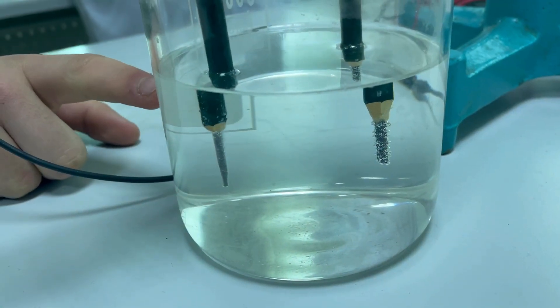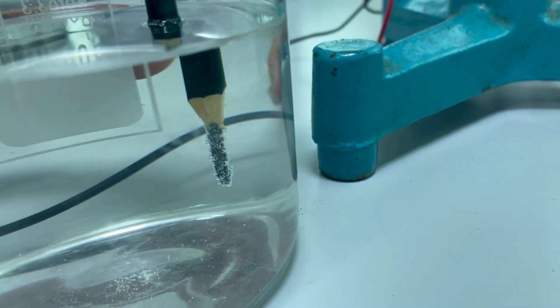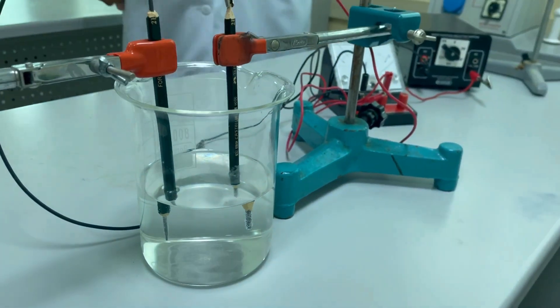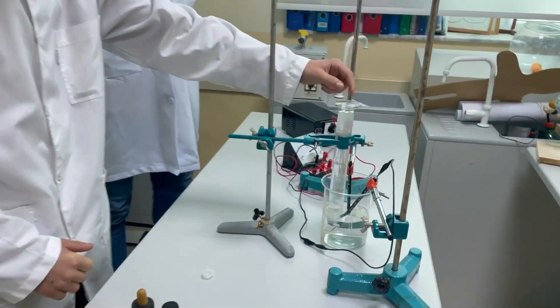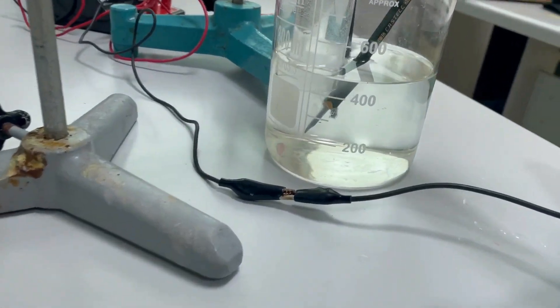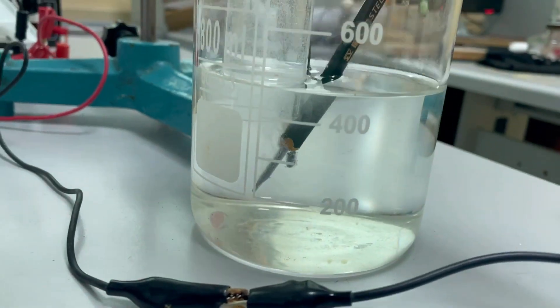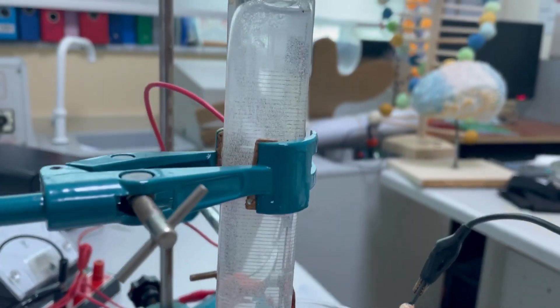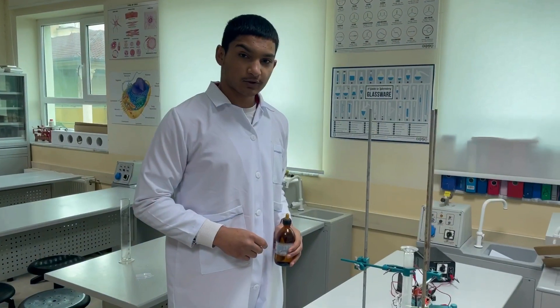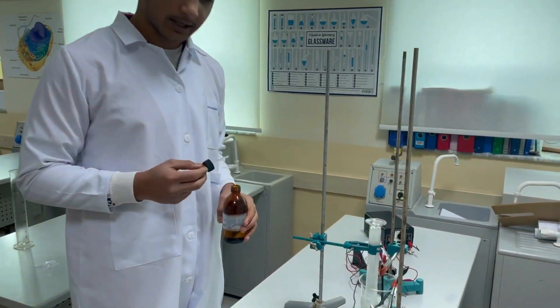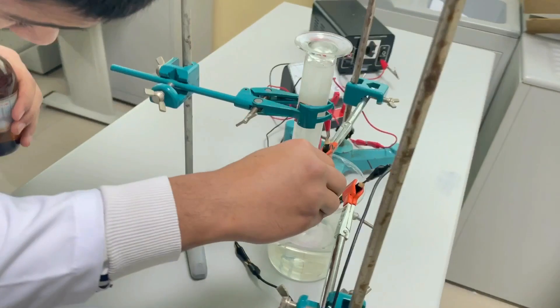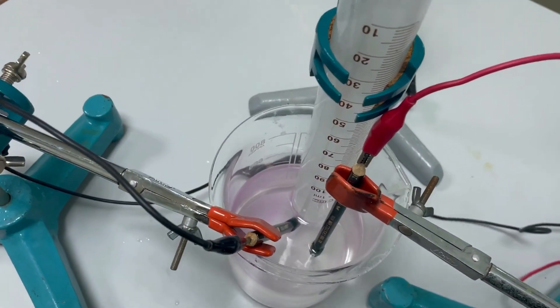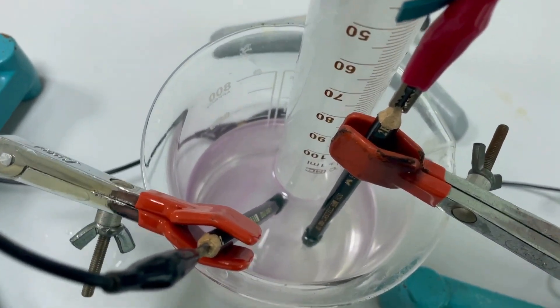Here is the production of hydrogen and here is the production of chlorine as gases. Here we are going to put the phenolphthalein indicator on an iron lid. The pink color shows the presence of sodium hydroxide produced by electrolysis.